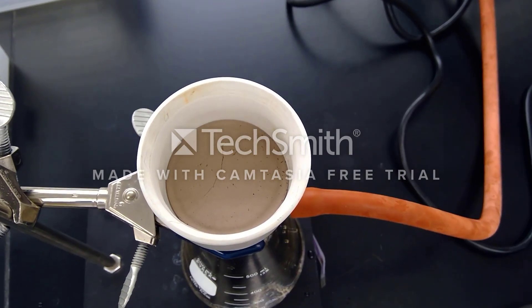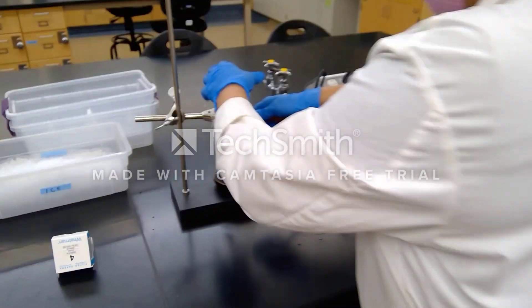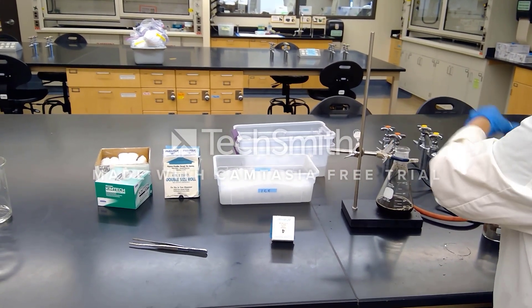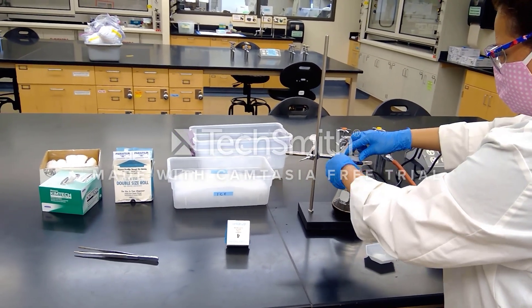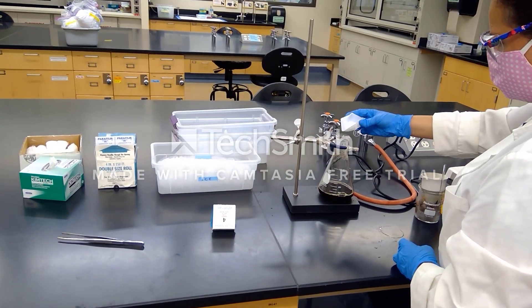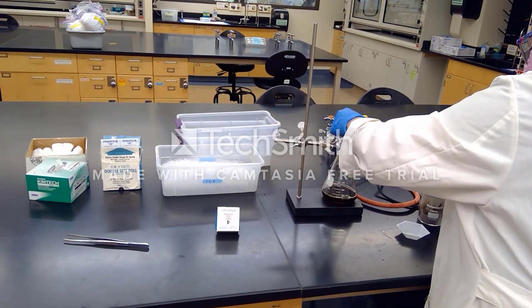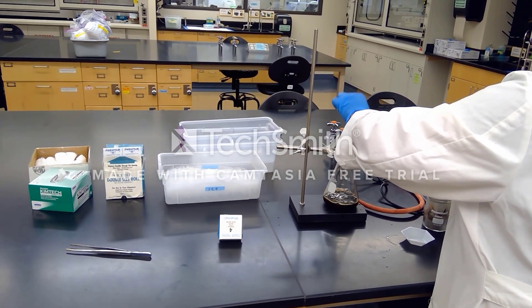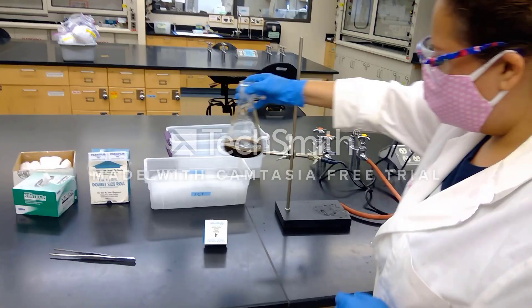Now we're going to go ahead and place our filtered solution on ice. But before we place it in ice we're going to add our salt, because as you might know from home, salt doesn't dissolve very well in cold solutions — so we're going to add it now. We're going to place this in an ice bath for about five minutes and we'll be back in just a little bit.